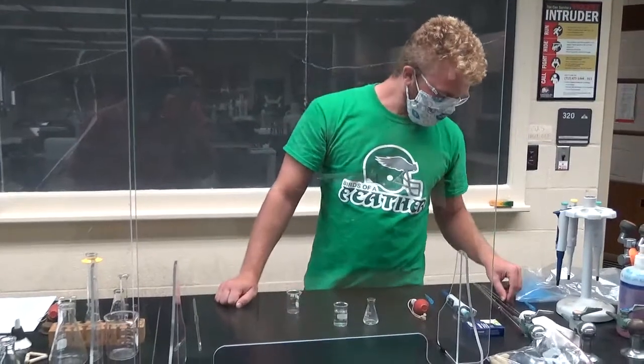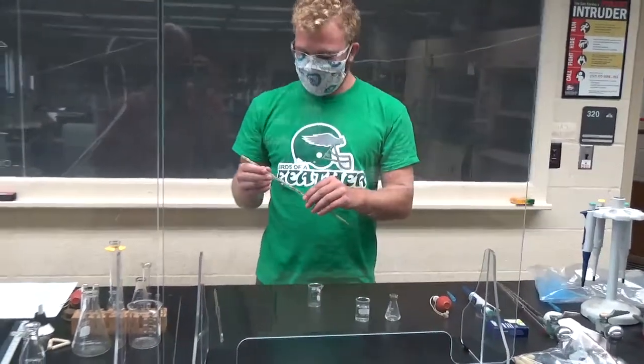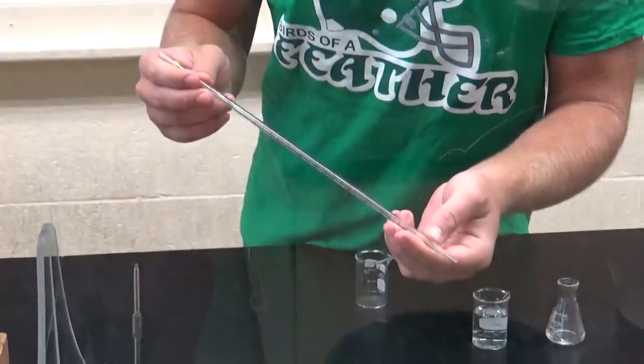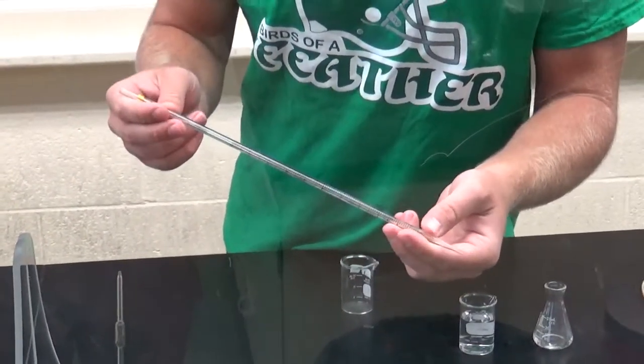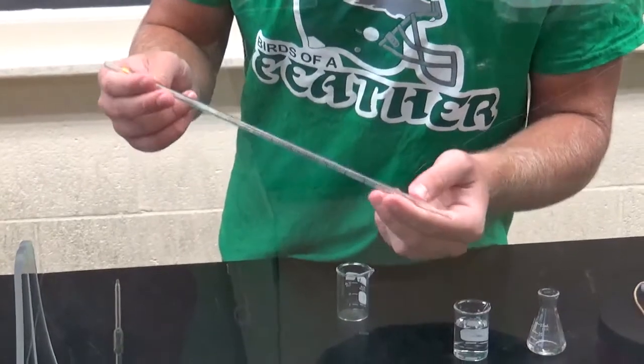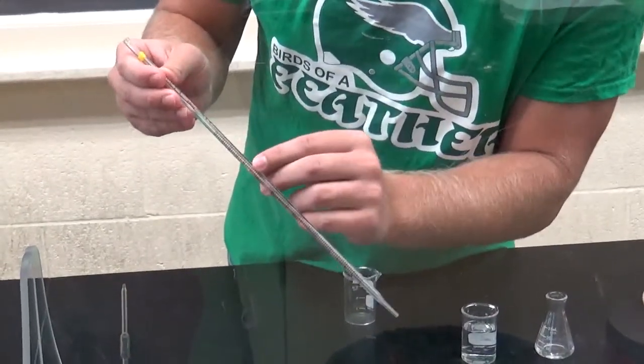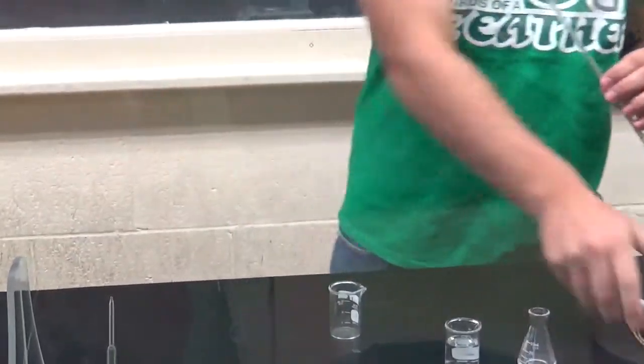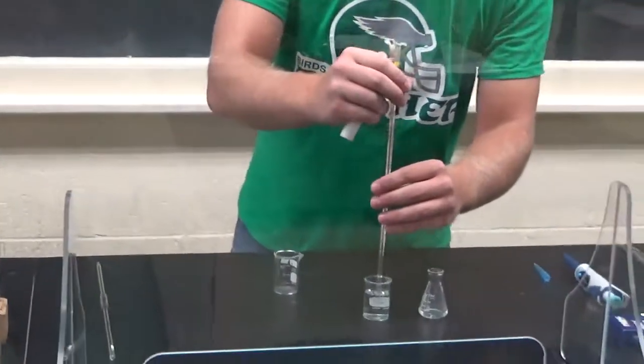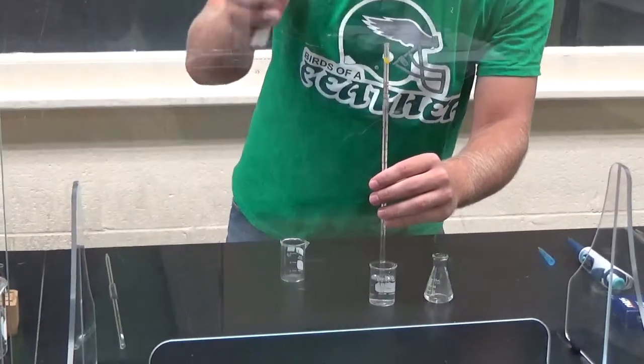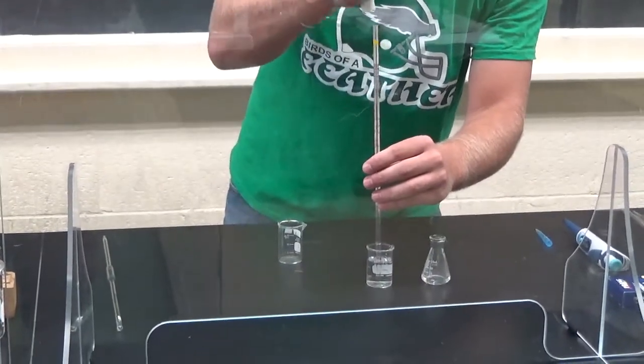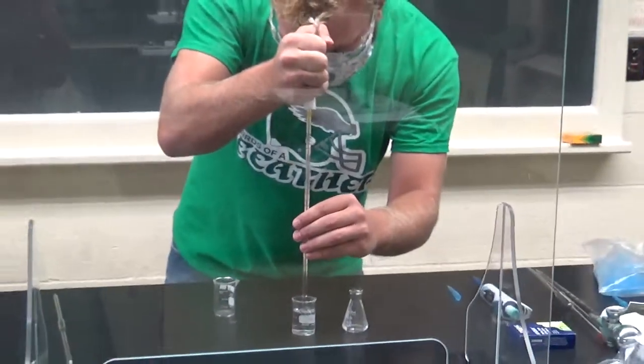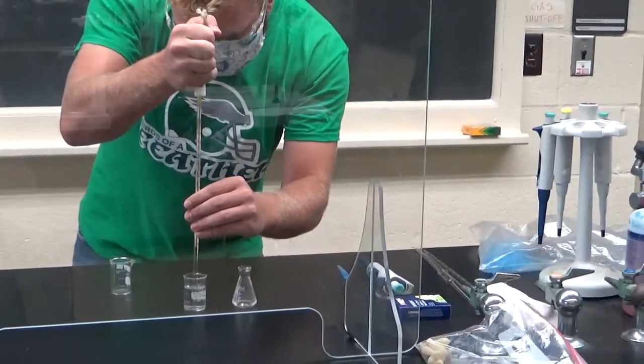What are we doing next? Here's a graduated pipette. As you can see, it has graduated lines on here. This one is a one milliliter graduated pipette. There's like 0.1, 0.2, 0.3. It's very similar to the volumetric pipette. When you want to pipette something, you do the same procedure. You always clear out the air in there and you come all the way up past the zero mark.